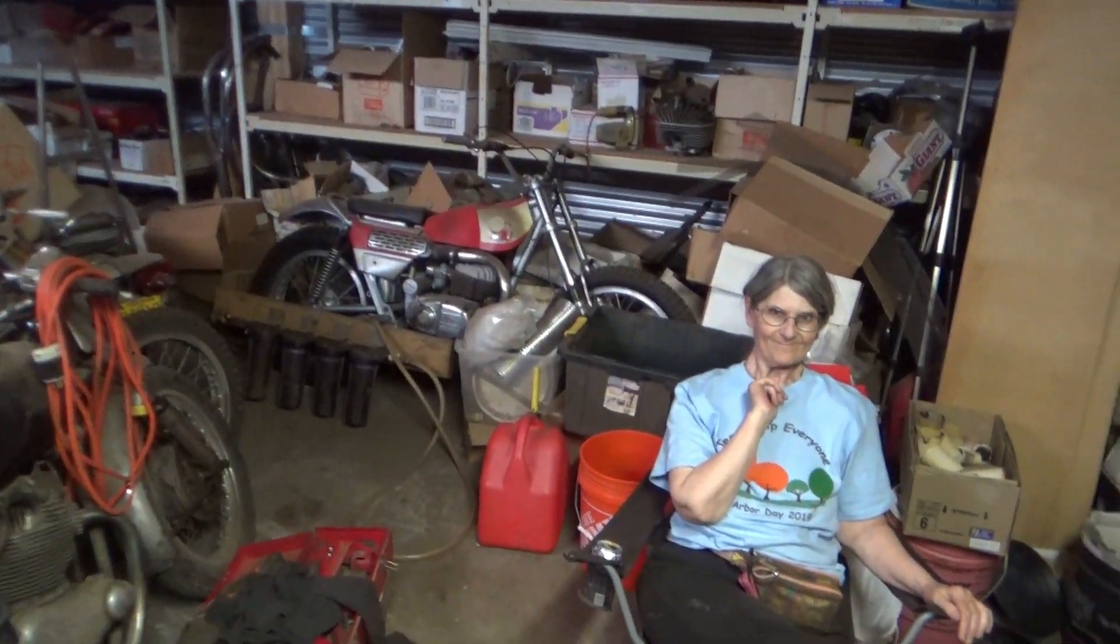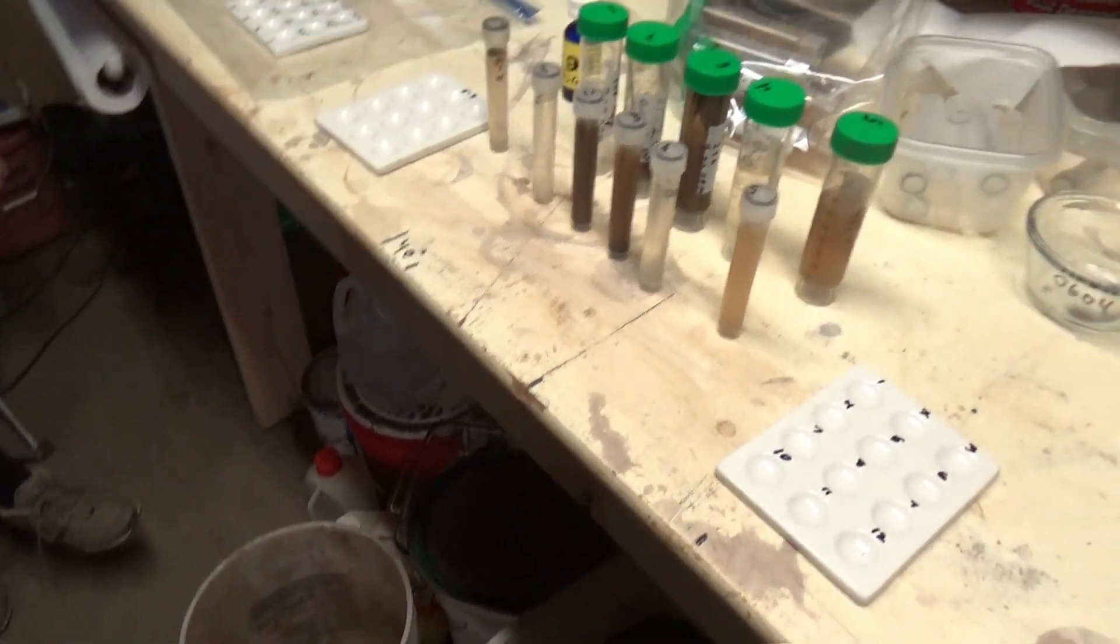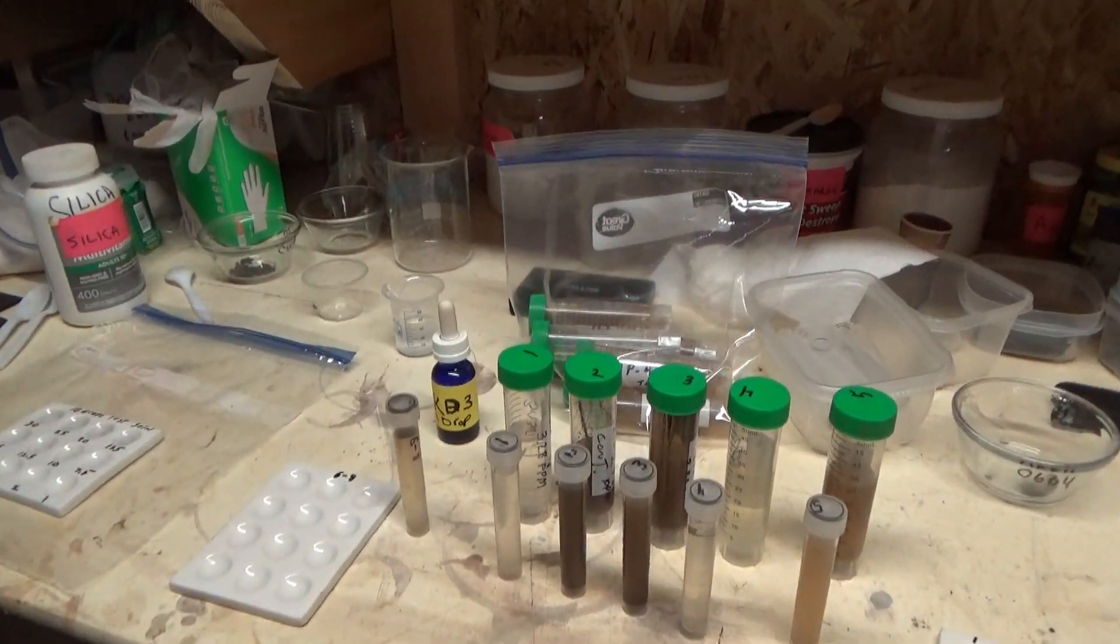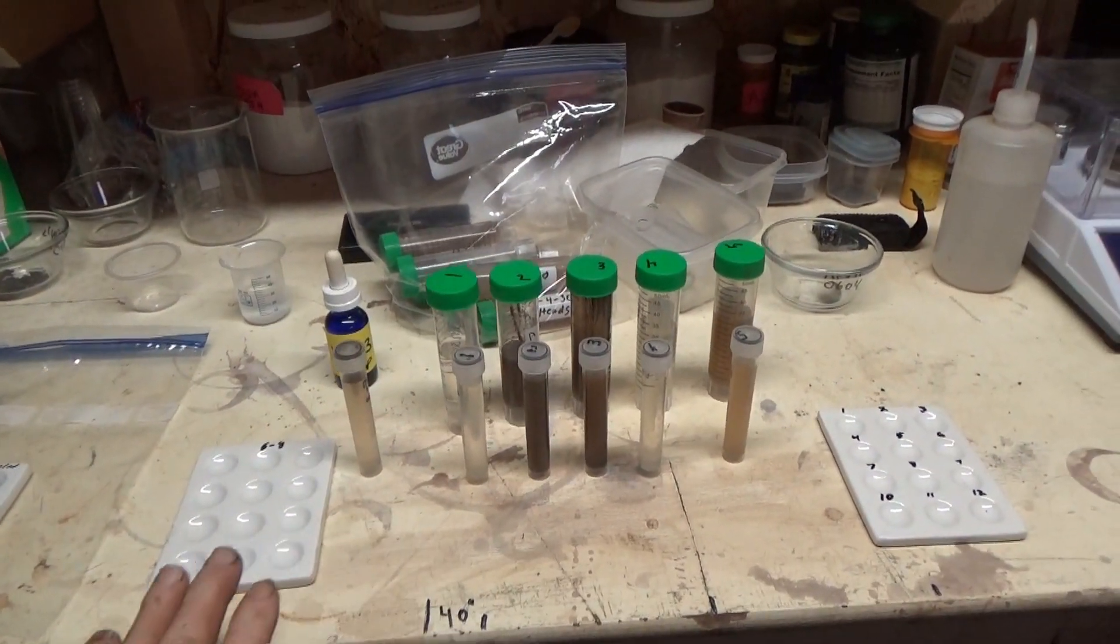Howdy folks, I'm Keith Bowen, this is Hard Rock University. Back in the lab, we've been monitoring some smelting stuff and I'm going to be testing our spot test to see how well it works against real solutions.